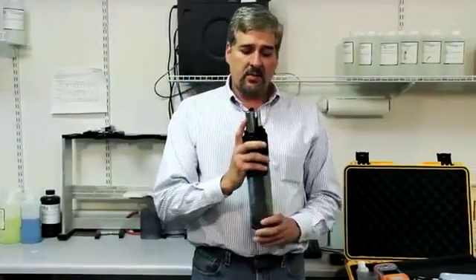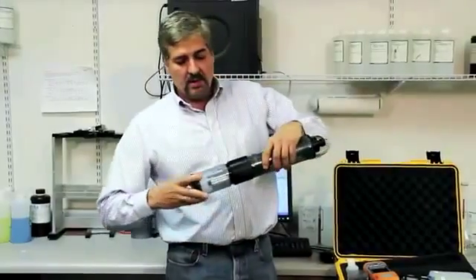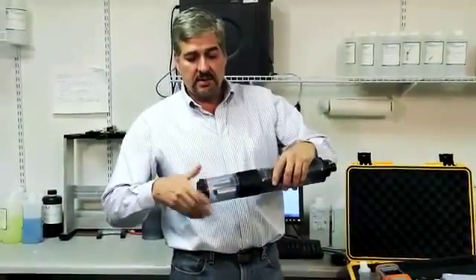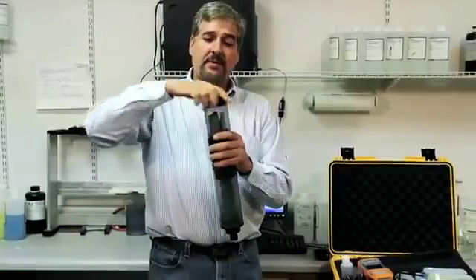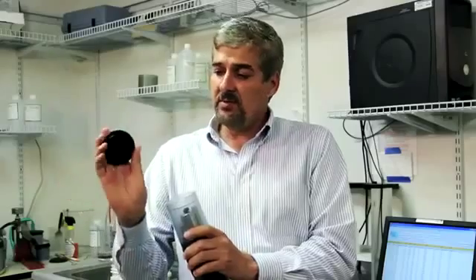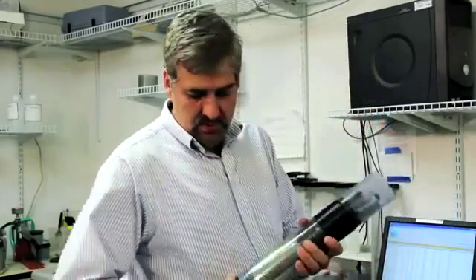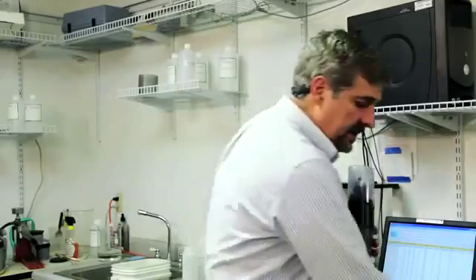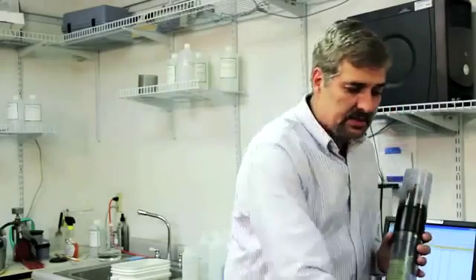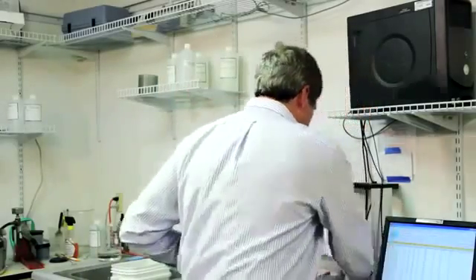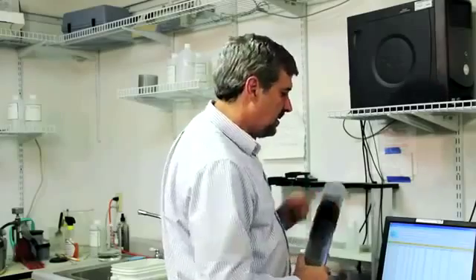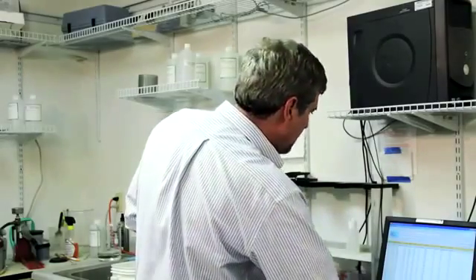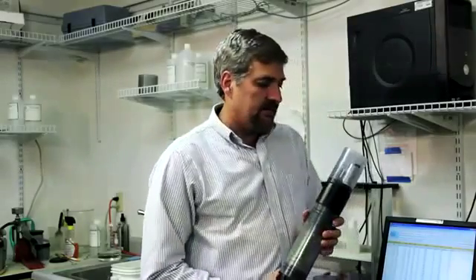When we calibrate an instrument, we'll use the storage cup. You remove the cap, it now becomes the calibration cup. Use the reverse side, and you can use this to do rinse. We're going to connect this to our PC. This screen is the same screen that you will see on your handheld device, but to speed it up, I'm going to do the calibrations with the PC. And we are connected.